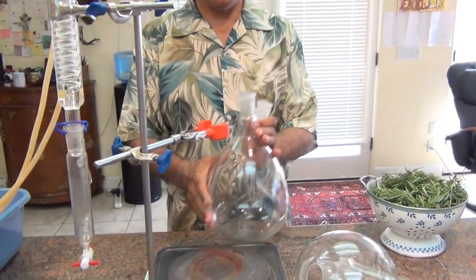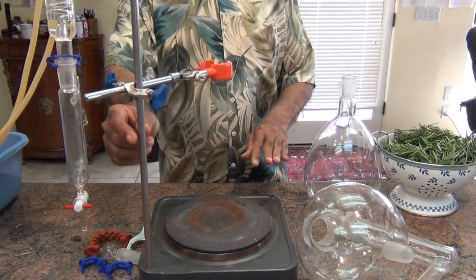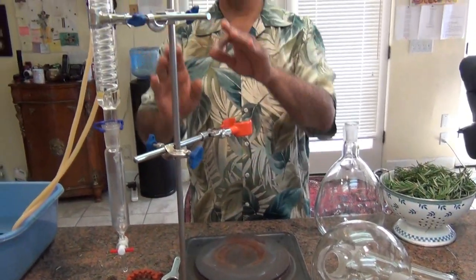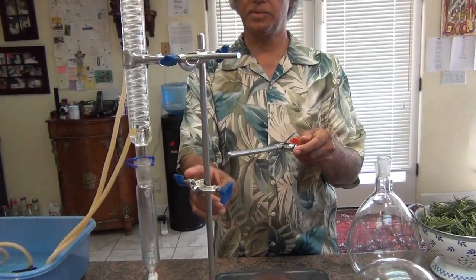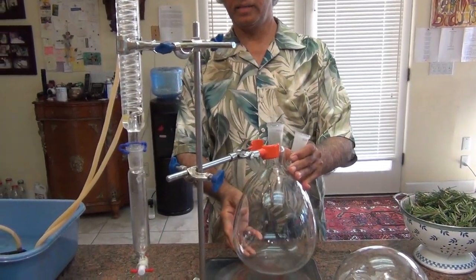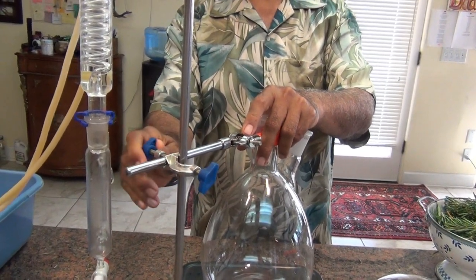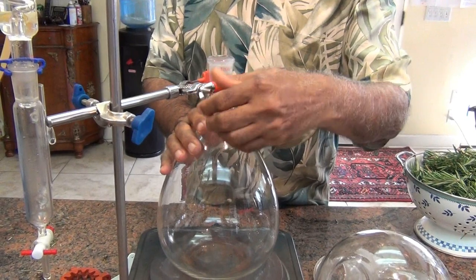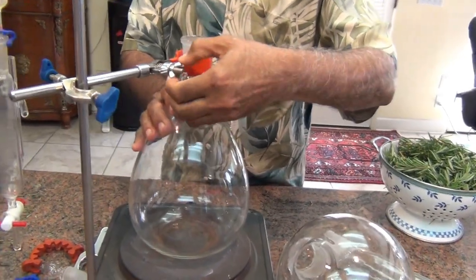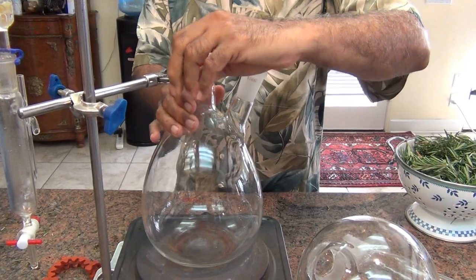So right here — let me show this. This is the heater, and this rod comes separate. You have to put it in on one end — just push it in. These are various clamps. First you put this clamp, just assemble these clamps together, put this in. This is the bottom flask — put that in. I'm going to move it a little further. Here is this clamp, and with that you tighten it. There we go.